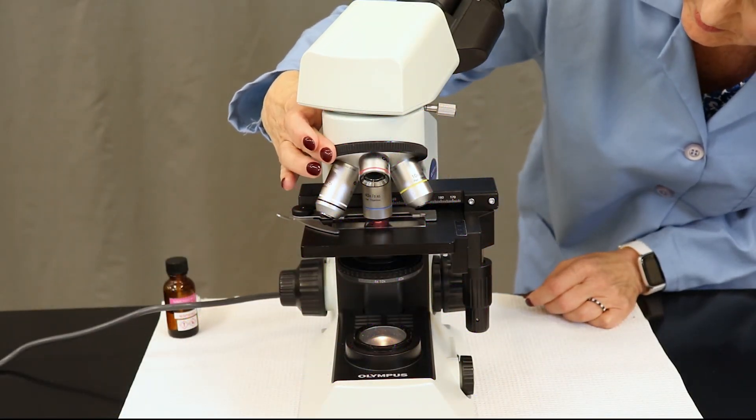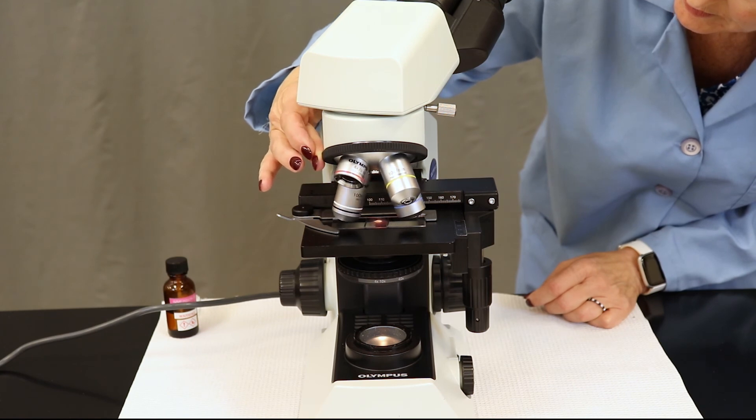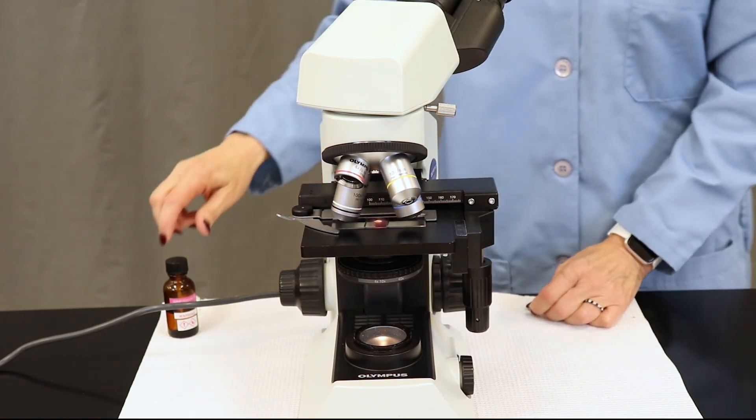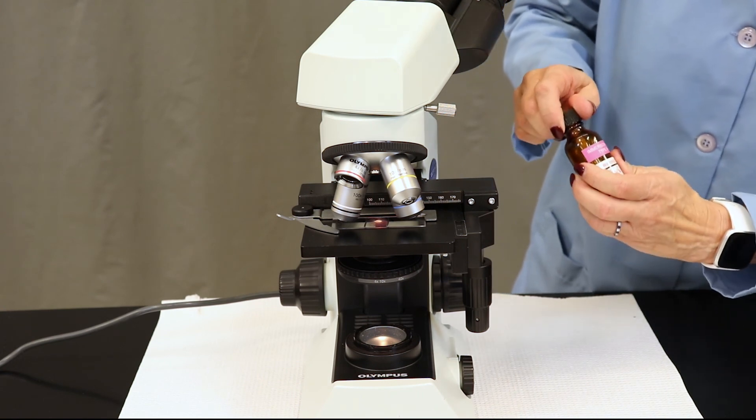Once you think you see cells, you're ready to move to oil. For this part, move the 40x out of the way.